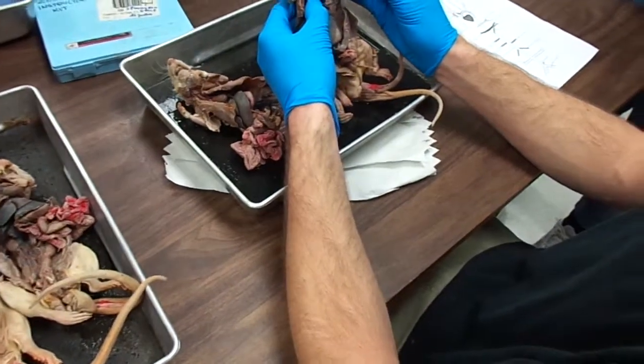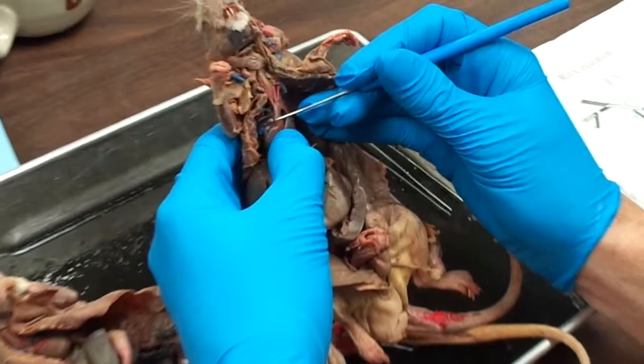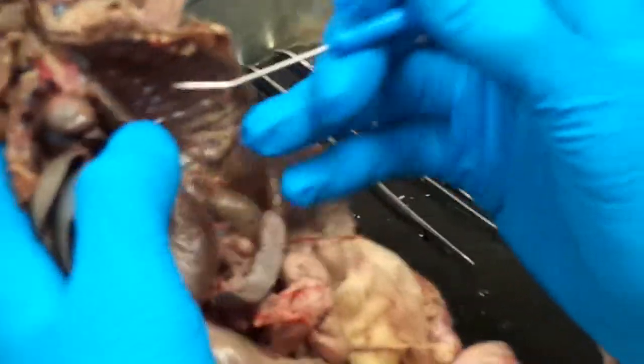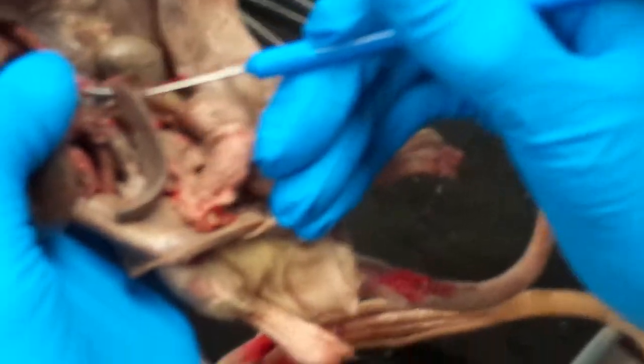The first thing we're going to see come out is the aortic arch. So coming out of the heart, we have the aortic arch. It's that nice U-turn we have there. And then it's going to form the descending aorta, which is this nice big guy that you see coming all the way down with all these other arteries coming off of them.